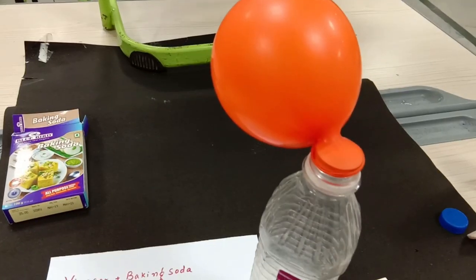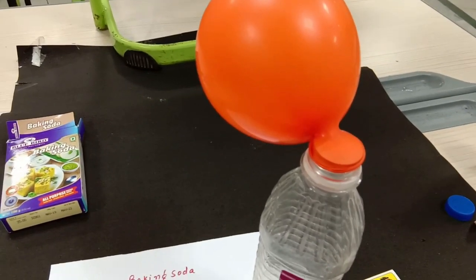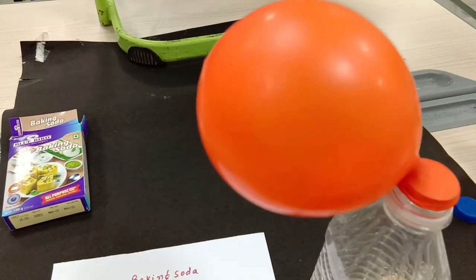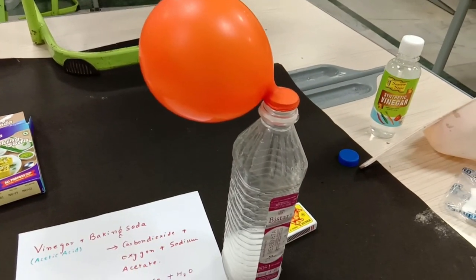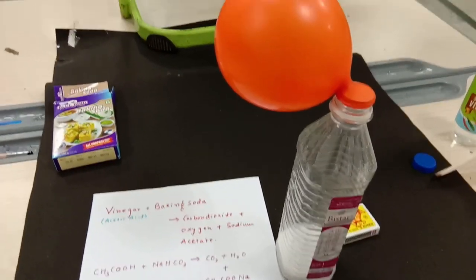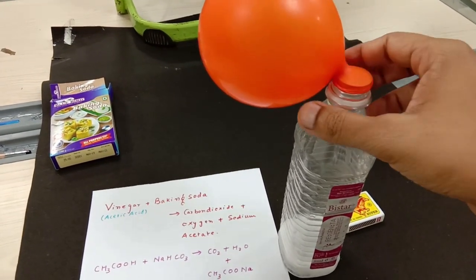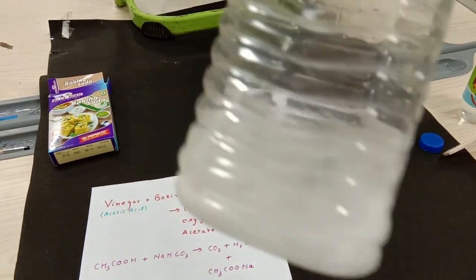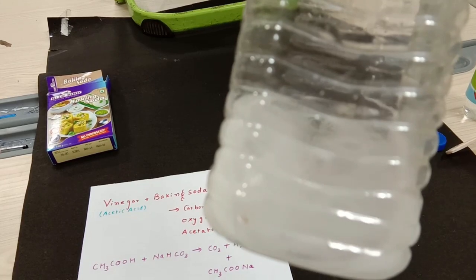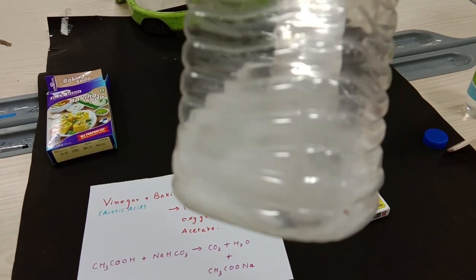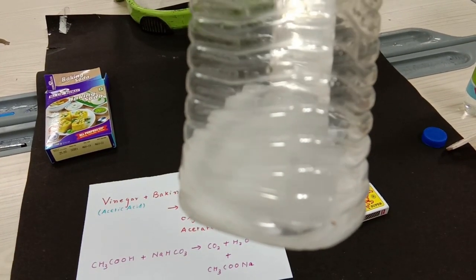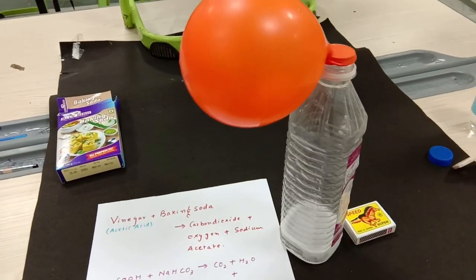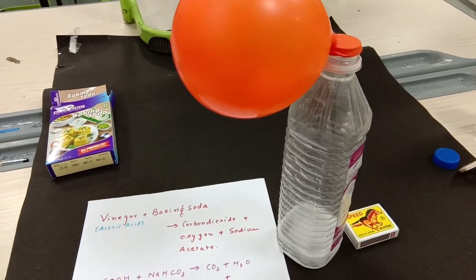We are going to see what is going to be done with our setup and see there are effervescence, bubbles that are happening because the carbon dioxide gas is going to be produced and that chemical reaction is happening. As you can see, the size of the balloon is continuously increasing.